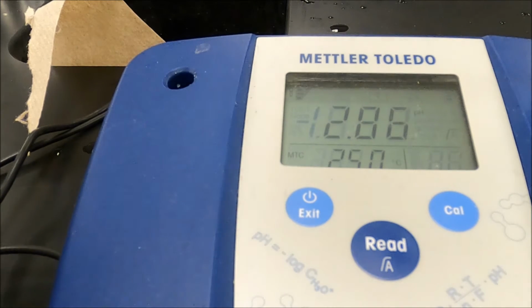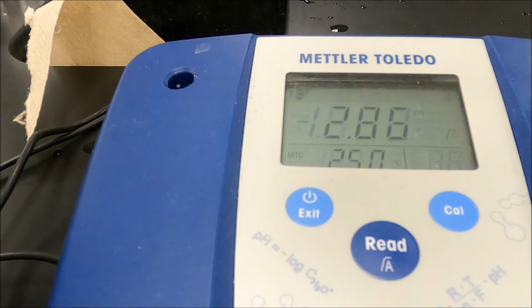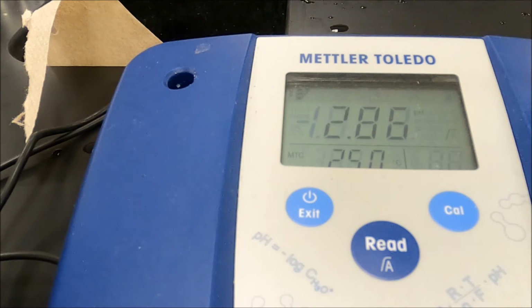Okay, we're going to go with 2.86. So the pH of our solution is 2.86. Hydronium ion concentration then will be calculated by taking 10 to the minus 2.86. Okay? Now I'm going to do my other two pipettings here as quickly as I can. And then we will hit things up with phenolphthalein again. It's one of our favorite indicators.